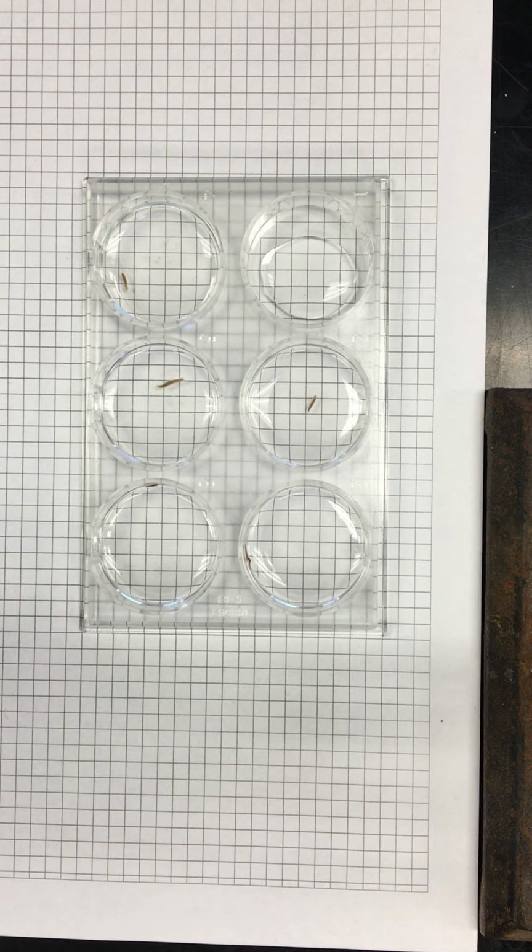Oh my god, you're killing me. Proper lab procedure. But that's in milliliters, so what is that in microliters? For sure, 30 microliters. Yeah, it's recording.